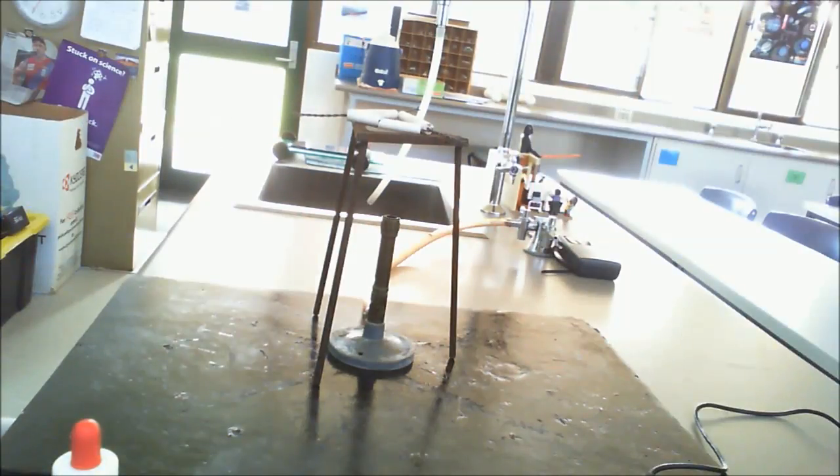Welcome, ladies and gentlemen, to Warwick Science's film practical of an acid carbonate reaction. As usual with all of our practicals, there will be a prac write-up that will come up on the screen. If you'd like to stop the video, get that down, and then restart the video when you are ready to go, that would be excellent.